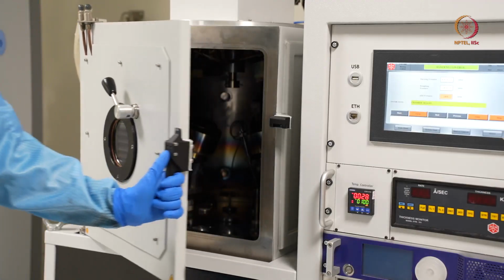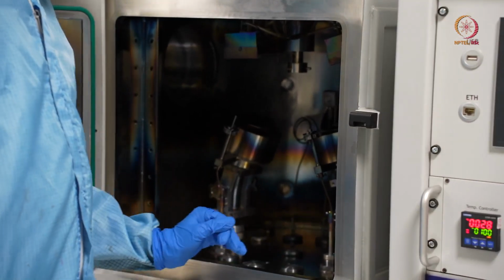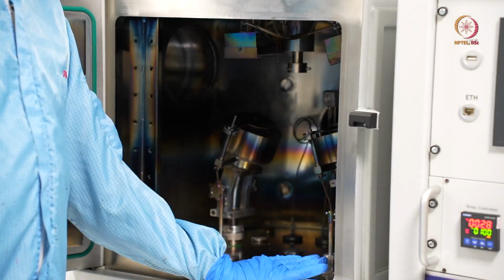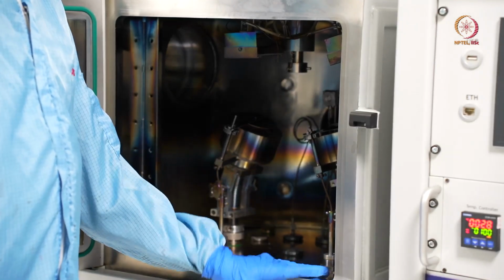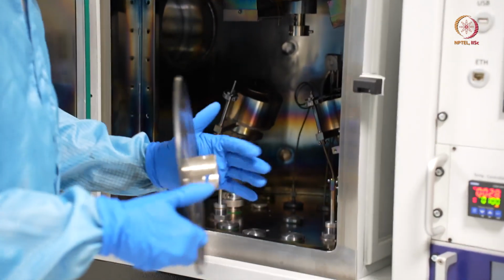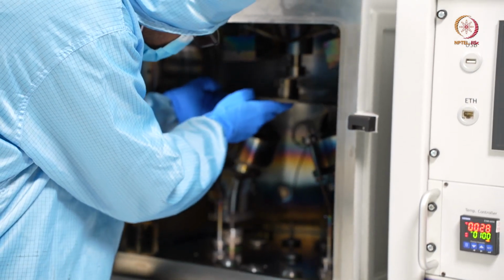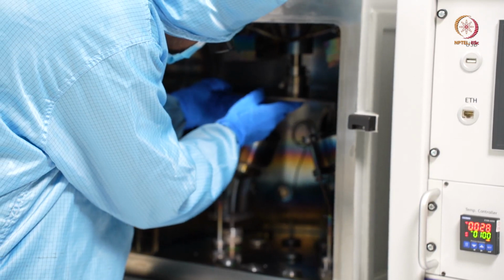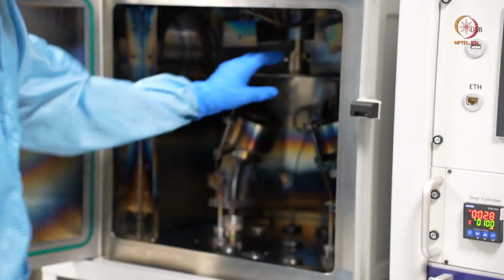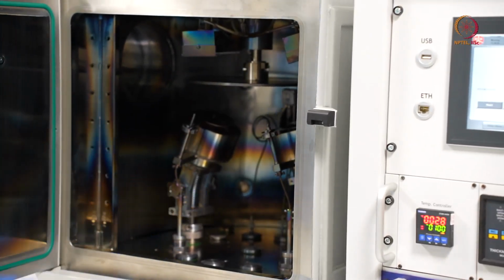Whenever we leave the tool, it is kind of mandatory that you close the chamber always, so that it will help you maintain a minimum contamination level of the chamber. We will just keep it in, as we have already shown how to place it back or take it out, so we are not showing the things again. Now this is already inside, so the chamber was actually clean.